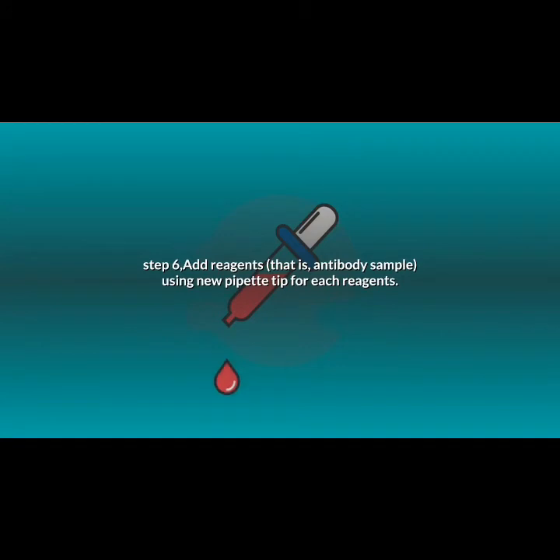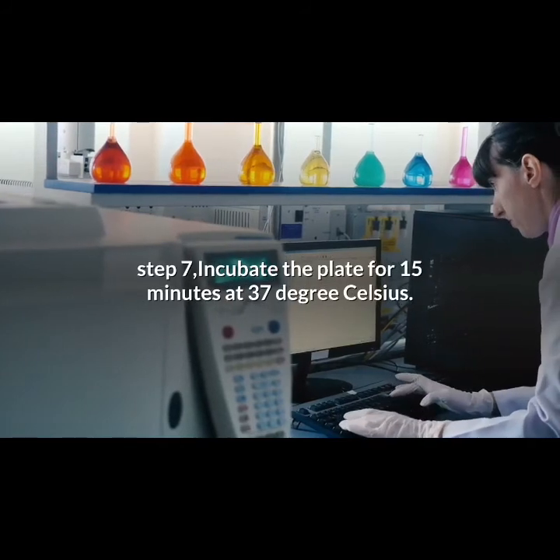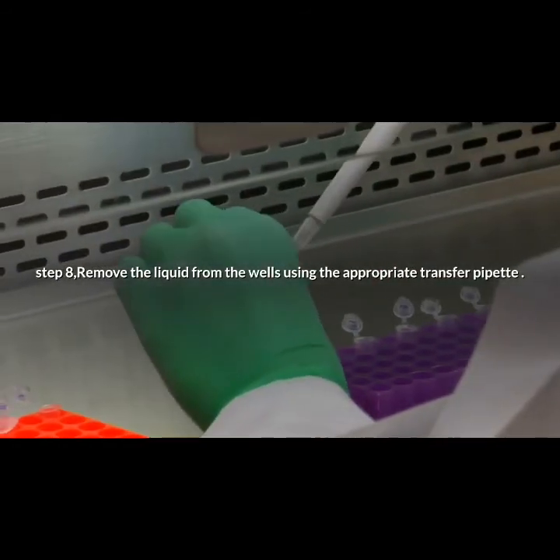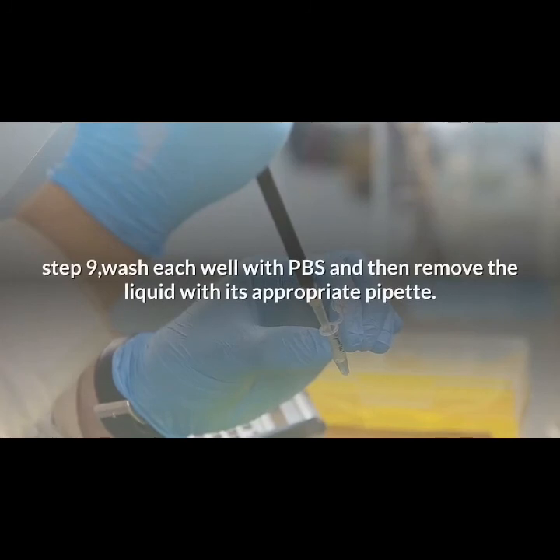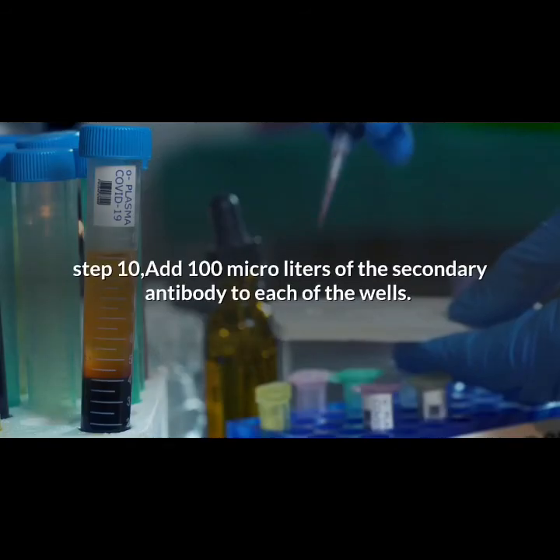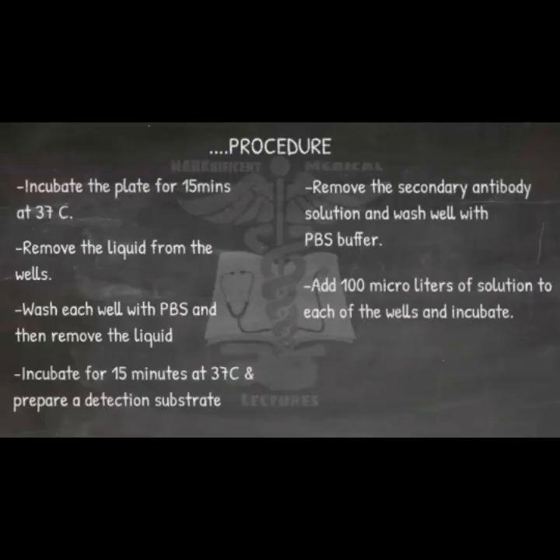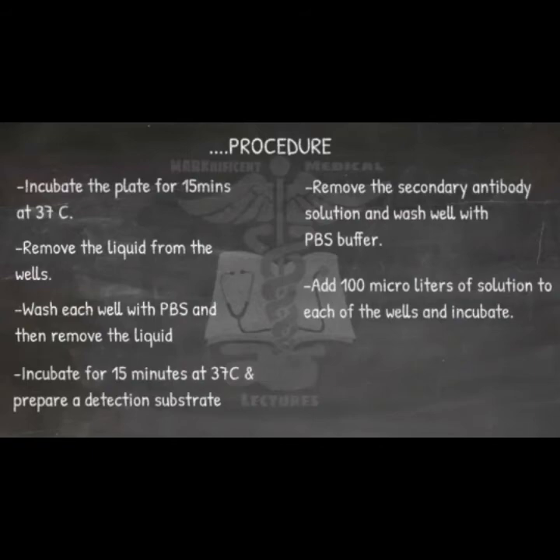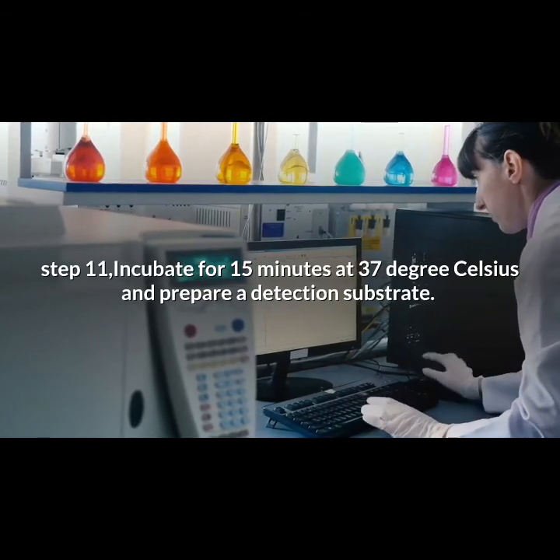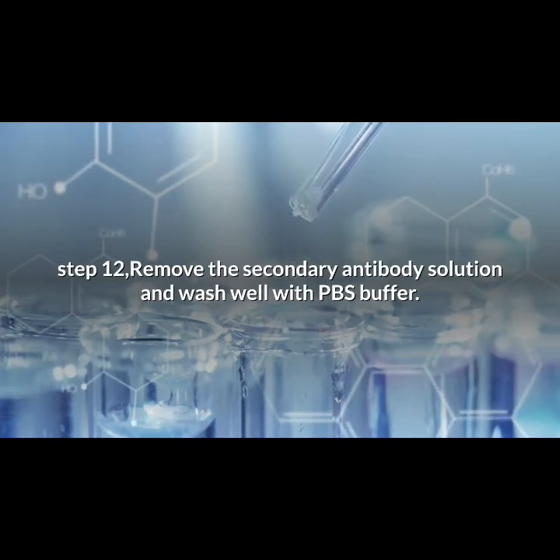Step 6 — Add reagents, that is, antibody sample, using a new pipette tip for each reagent. Step 7 — Incubate the plate for 15 minutes at 37 degrees Celsius. Step 8 — Remove the liquid from the wells using the appropriate transfer pipette. Step 9 — Wash each well with PBS and then remove the liquid with its appropriate pipette. Step 10 — Add 100 microliters of the secondary antibody to each of the wells. Step 11 — Incubate for 15 minutes at 37 degrees Celsius and prepare a detection substrate. Step 12 — Remove the secondary antibody solution and wash well with PBS buffer.